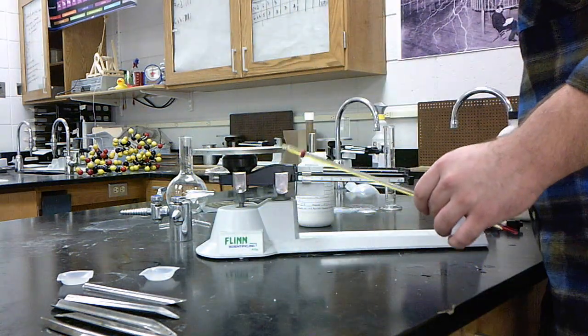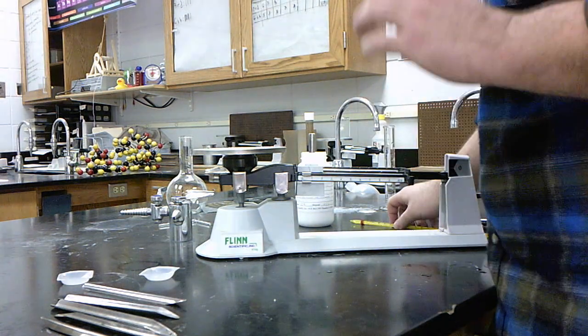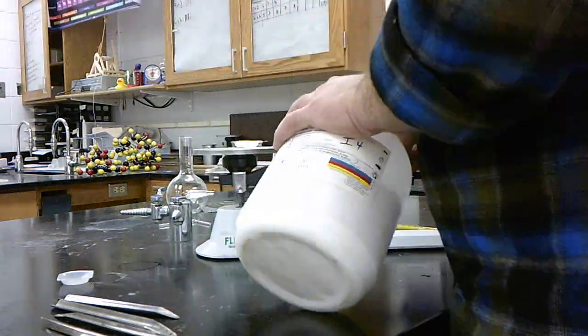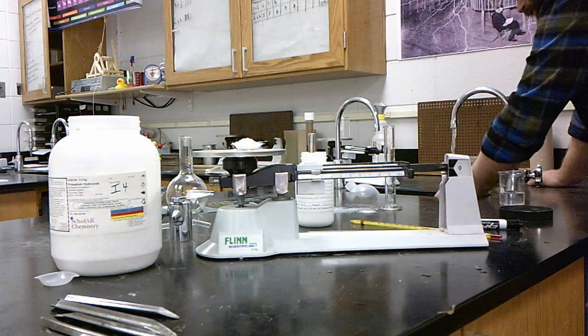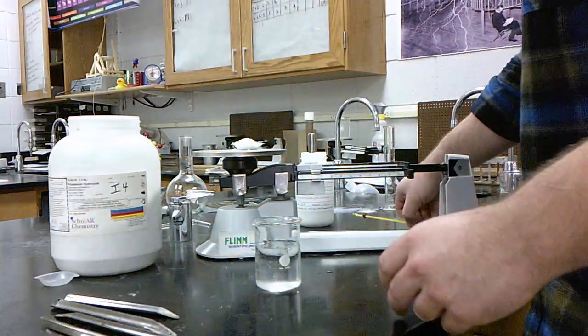Let's set that aside. Wipe this off. And then I needed 11 grams of potassium hydroxide. So let's just add one more gram to this. Probably should have been wearing gloves, but you know.